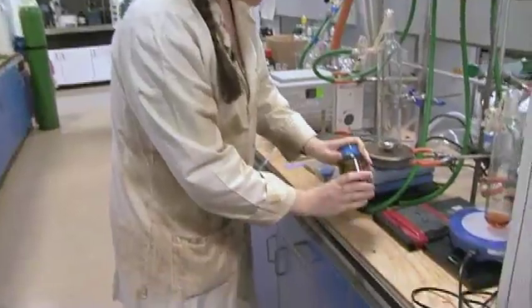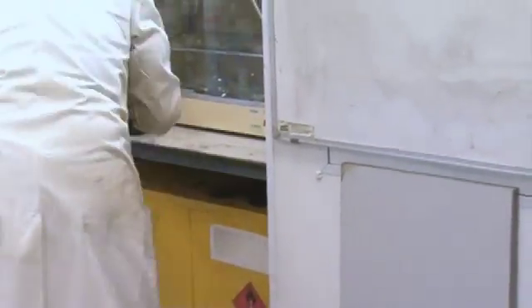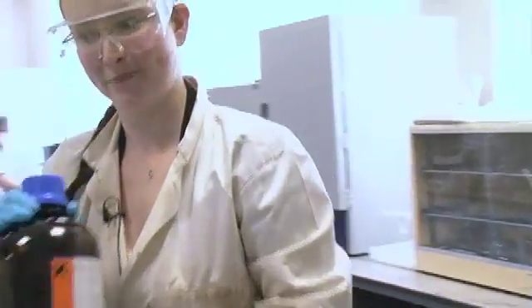So what we're going to do is we're going to take some of this sodium, we'll put it in some hexane, which I'll go and get now. We've got to cut it up under something inert, like hexane. People use things like hexane or petroleum ether.